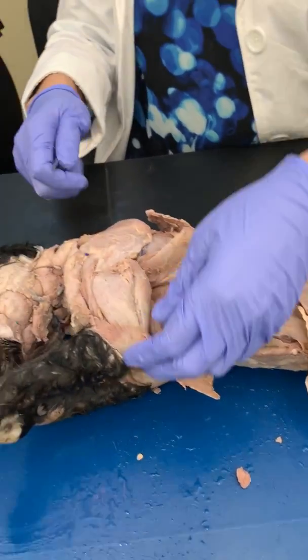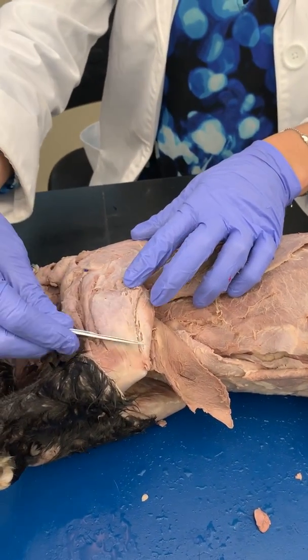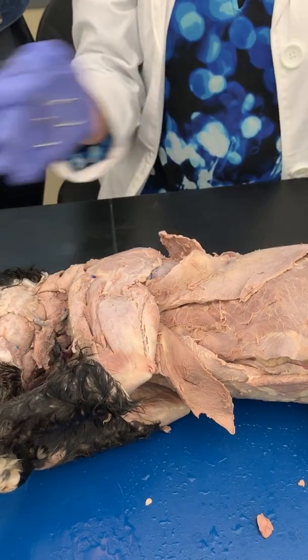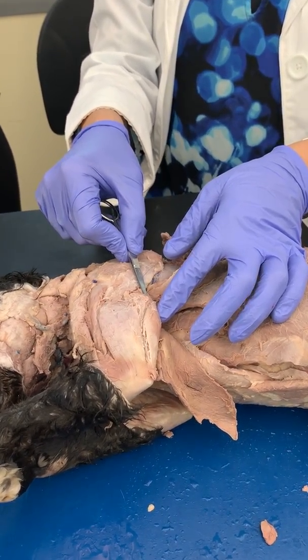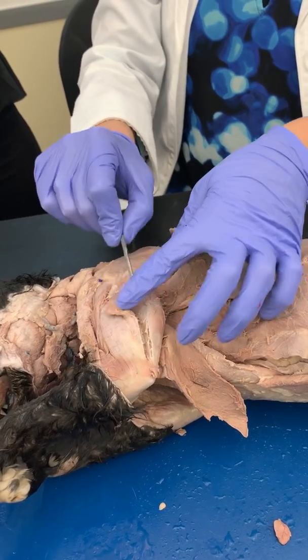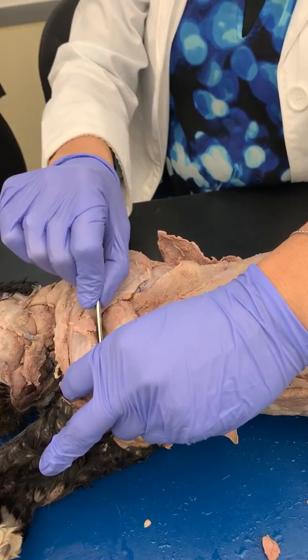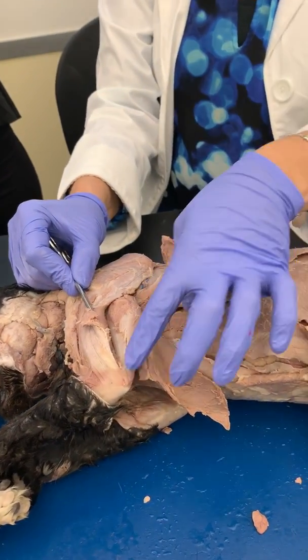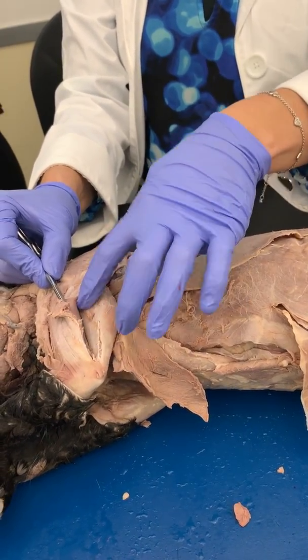And then the arms. You have your tricep, that's the back of the arm. You have the lateral, your triceps brachii lateralis, because it lies further laterally. You have your triceps brachii longus, and then deep in here, and I don't expect you to really find that one, you have a medial branch of that tricep. So tricep means three heads. It's got the longus, the lateralis, and then the medialis.